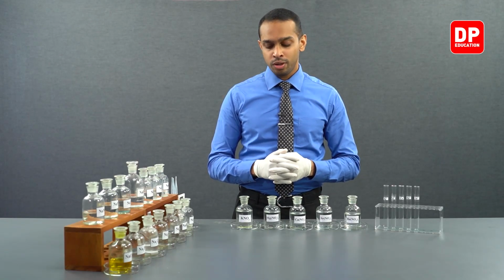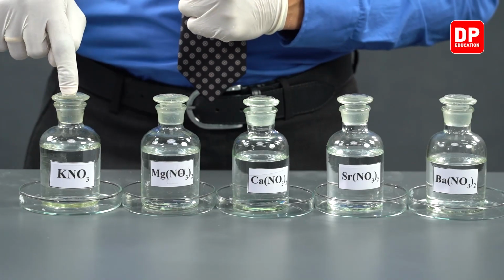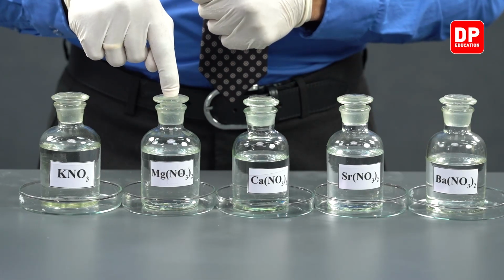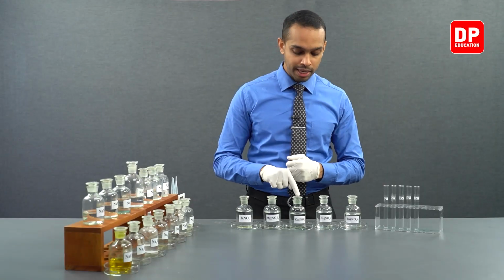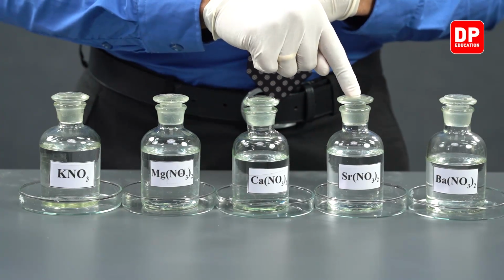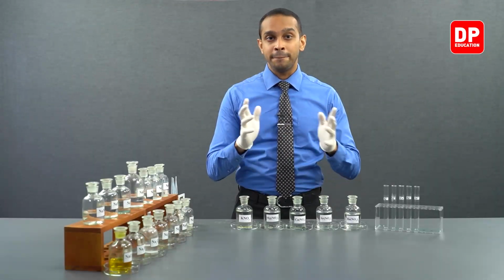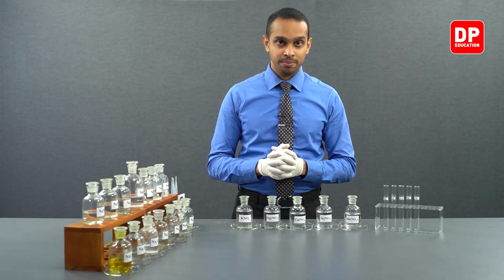So therefore, to obtain potassium 1+ ions, we will be taking potassium nitrate. To obtain magnesium 2+ ions, we will be using magnesium nitrate. To obtain calcium 2+ ions, we will be using calcium nitrate. To obtain strontium 2+ ions, we will be using strontium nitrate. And finally, to obtain barium 2+ ions, we will be using barium nitrate.